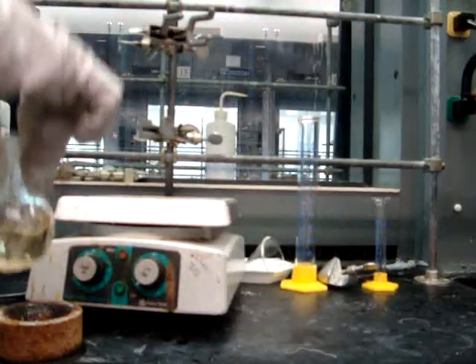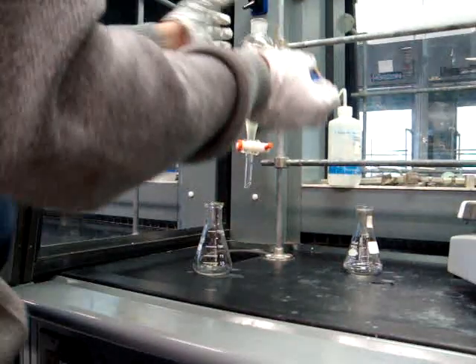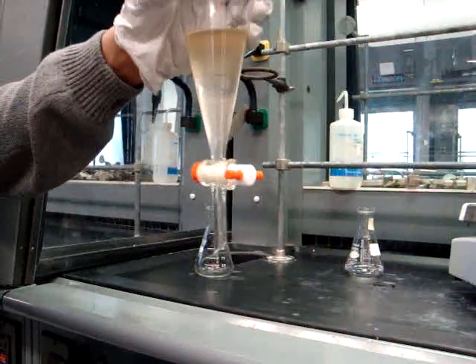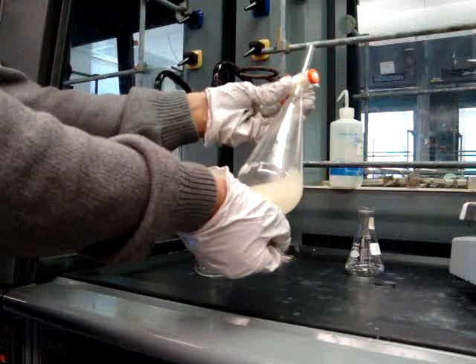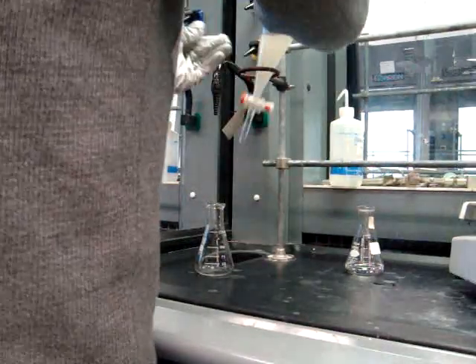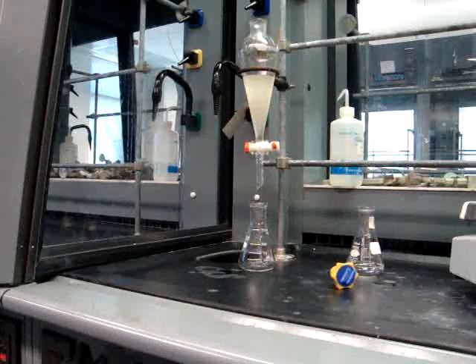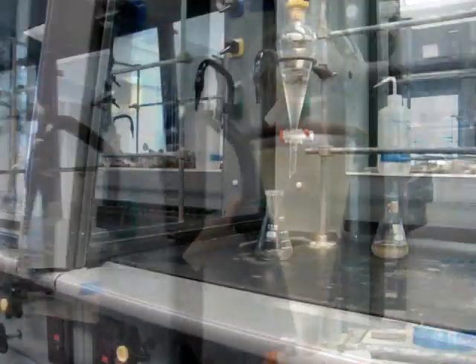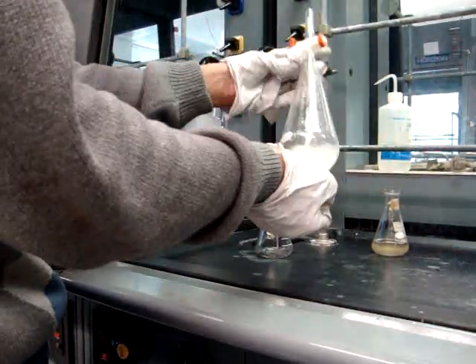Now you'll extract with two 10mL portions of methylene chloride. You'll be extracting the dichloromethane layer. If you have any questions regarding extraction, refer back to the videos involving extractions. You'll be washing the combined methylene chloride layers with two 8mL portions of water. During both extractions, the dichloromethane will be in the bottom layer, so make sure that you are keeping the bottom layer.